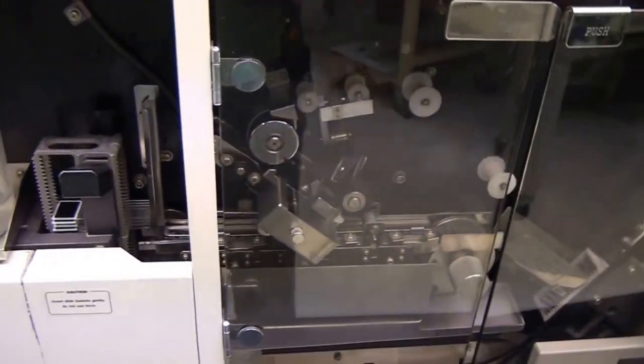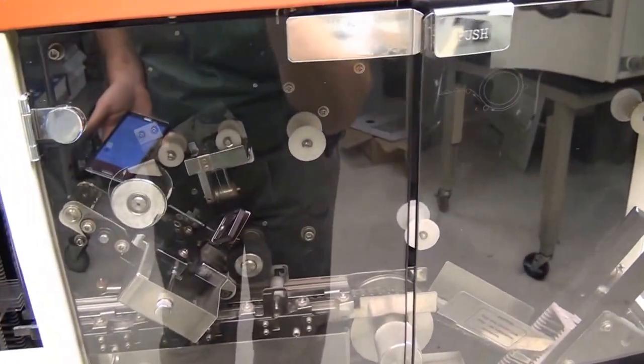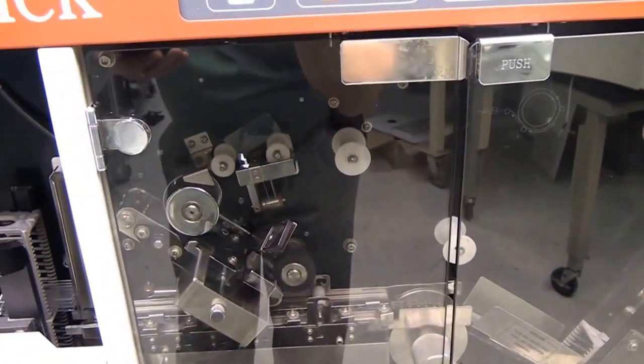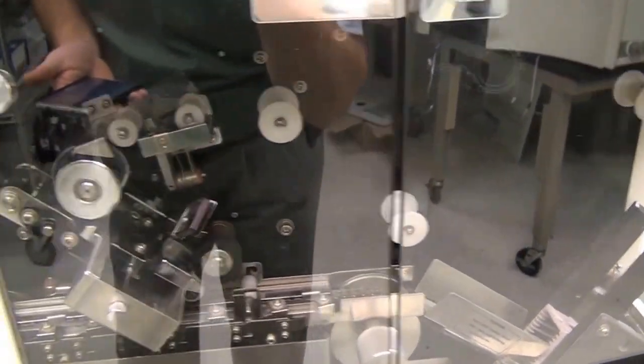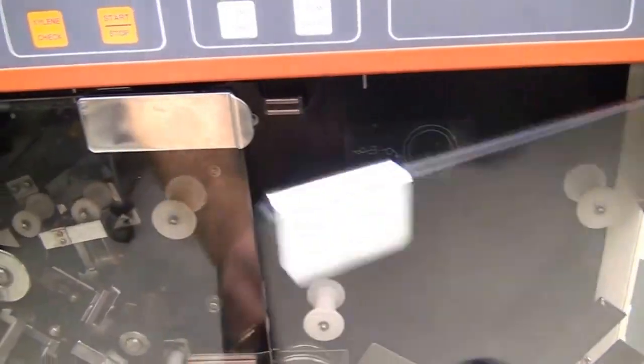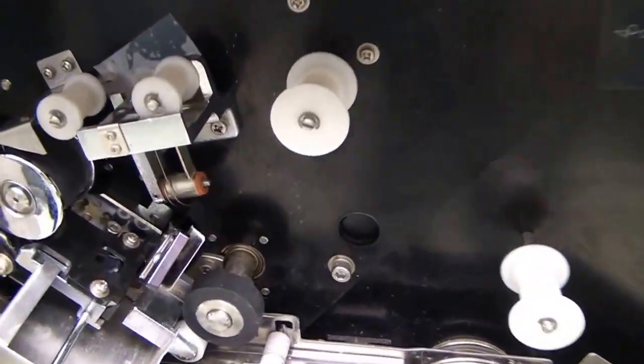We're going to give you a little demonstration of how smooth this works. Unfortunately we do not have any of the film as you can see in here. I'll go ahead and open this up so we can get a better look at this unit.